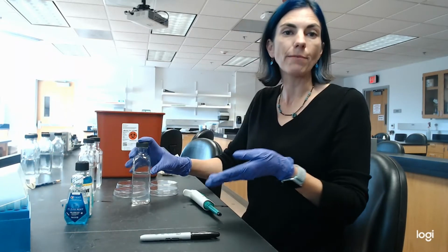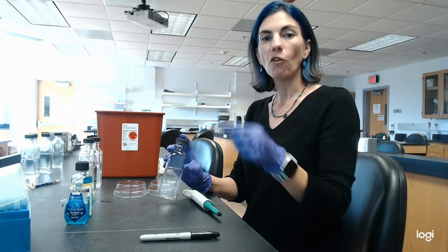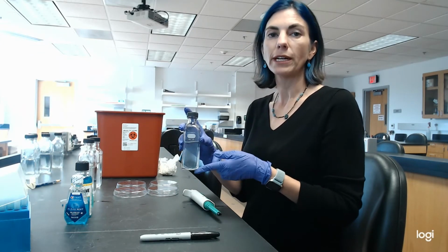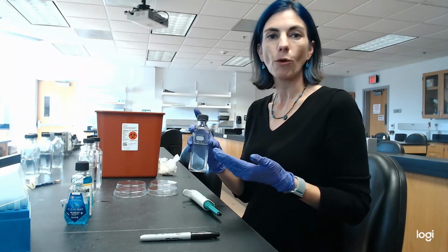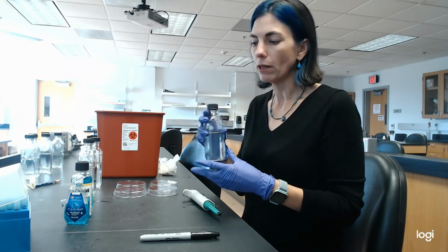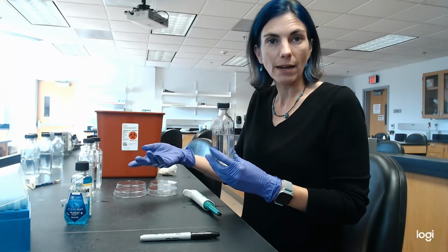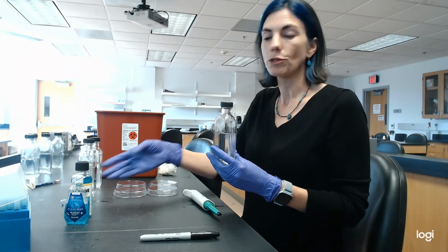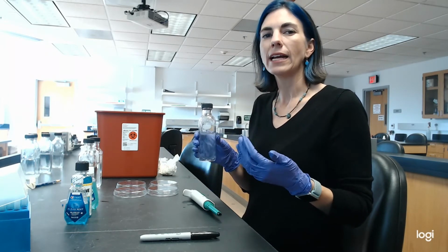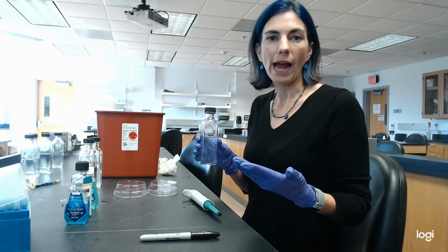I've got time now. That 30 seconds is really just about what's being mixed in the tube before doing your first dilution. The reason is because once it gets diluted into bottle A, whatever is antimicrobial in your original test tube, in our case, water is not antimicrobial, but we expect that these will be antimicrobial, whatever is antimicrobial about that particular solution, mouthwash, gets diluted out to such an extent in bottle A that it usually ends up stopping whatever antimicrobial reaction was occurring.